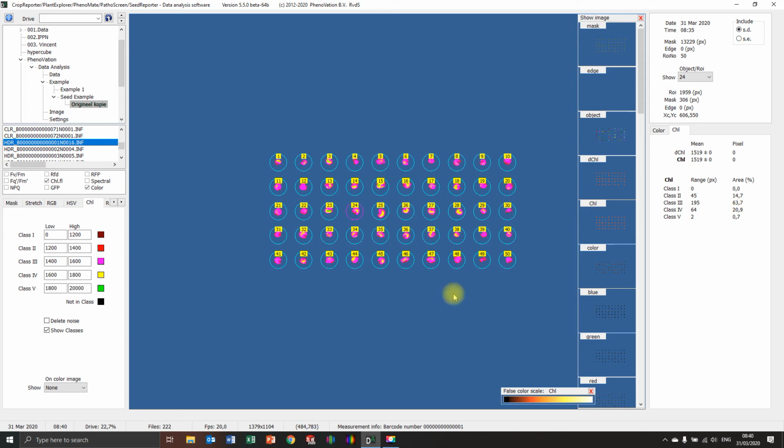You could also say, well, okay, it's too big of a step. I want to make sure everything is in one class. So then what you can do is lower this one, so you do smaller steps. For example, I would put this on 1800 and 1800 to 1700. There was a lot in this class, so 1700 until 1600, then 1600 until 1500. You can also already see change. And now this one until 1500. Okay, then still a lot is in the bottom one, but now you can see a spread of every part.